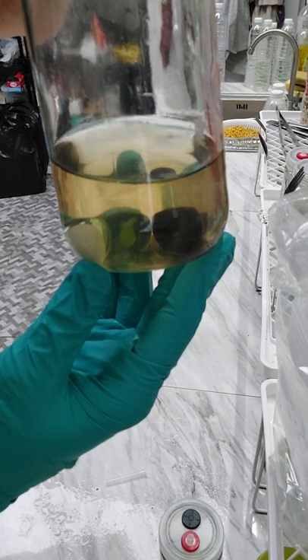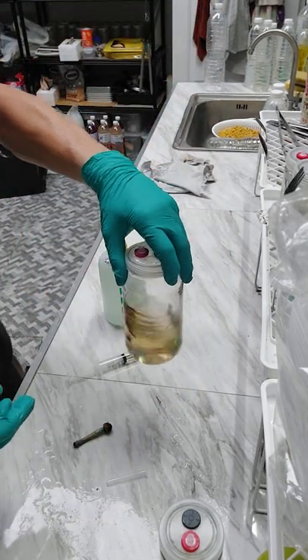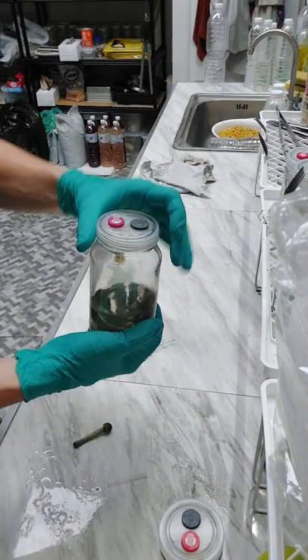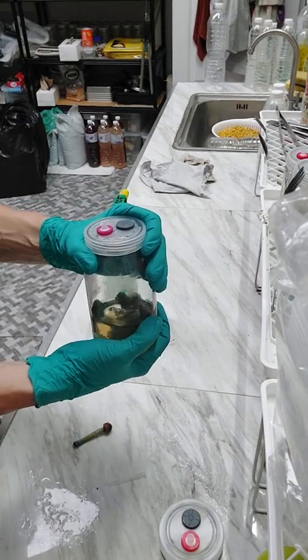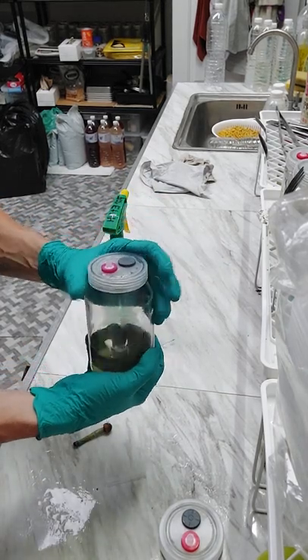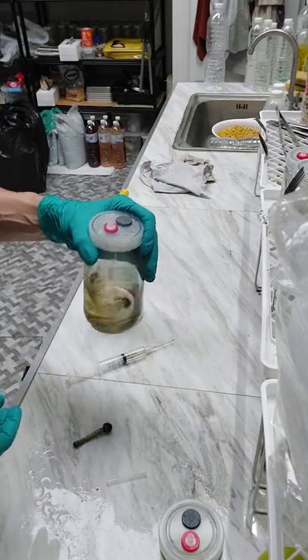It's only the diameter of an 18 gauge needle, so it's quite small. Now I'm going to give this a few more shakes, and that is to get a little bit of oxygen in there. The oxygen has been depleted from this liquid media, or LC — liquid culture, soon to be cultured. So I want to get a little bit of oxygen in there.